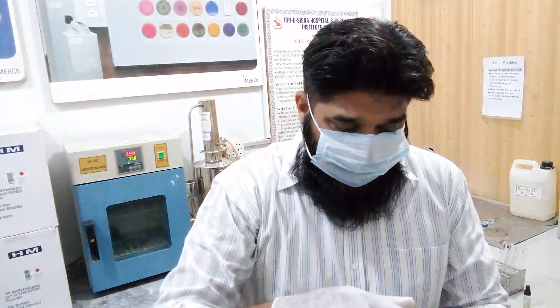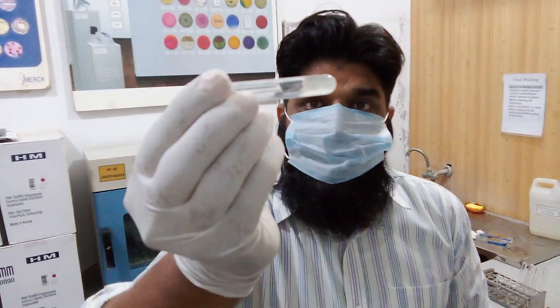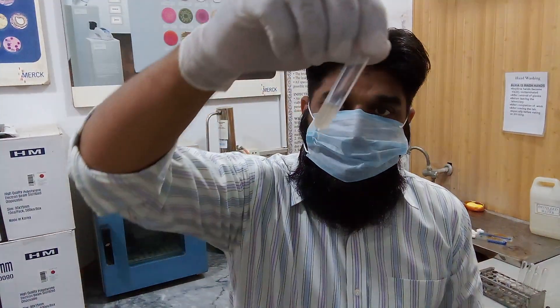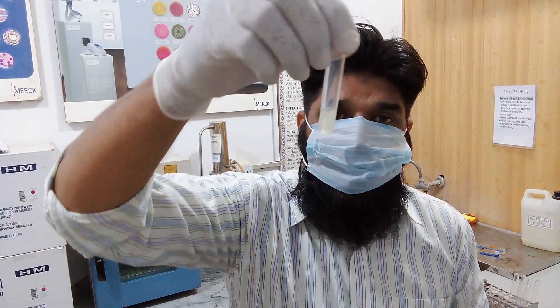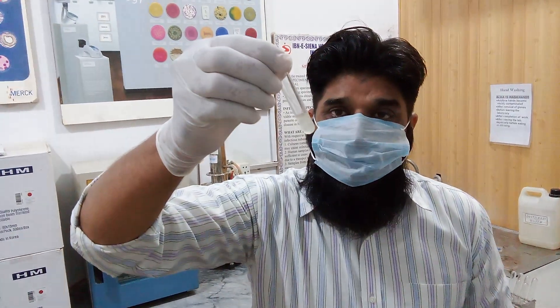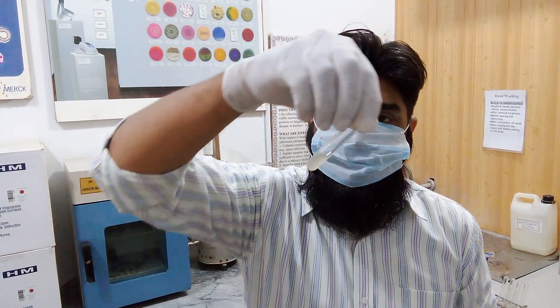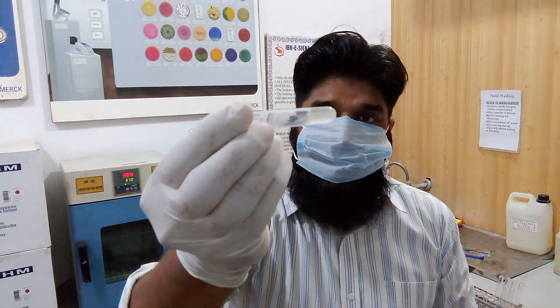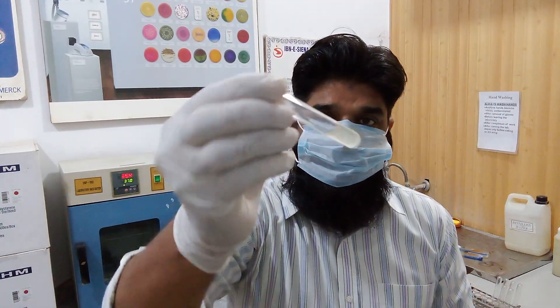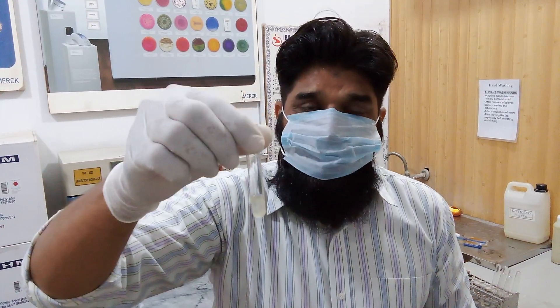Now second, we can see this condition. You can see there is no movement of liquid fluid — this is clotting, clotting has taken place. Under the effect of coagulase enzyme, fibrinogen has been converted into fibrin. You can see there is no movement of the liquid surface. It is complete clot formation. This is a positive coagulase test.